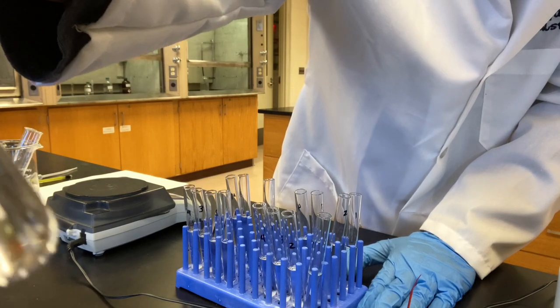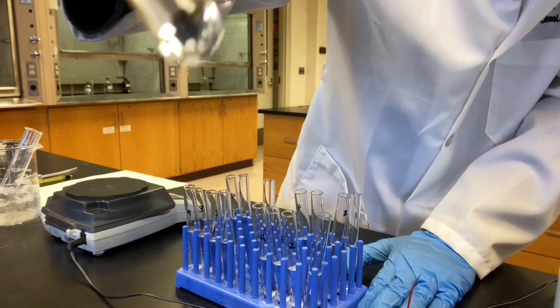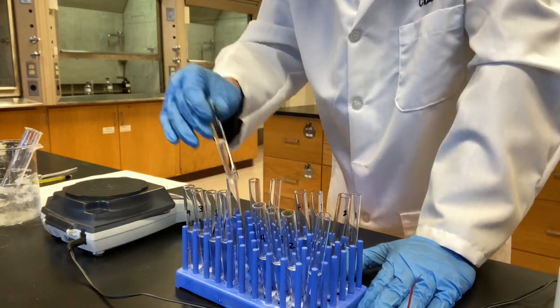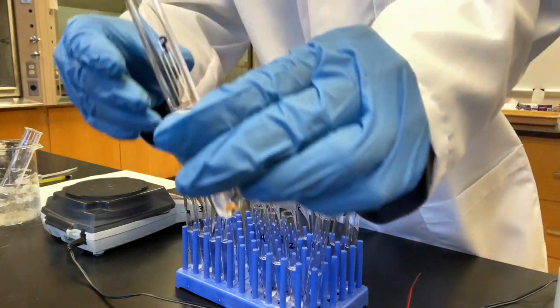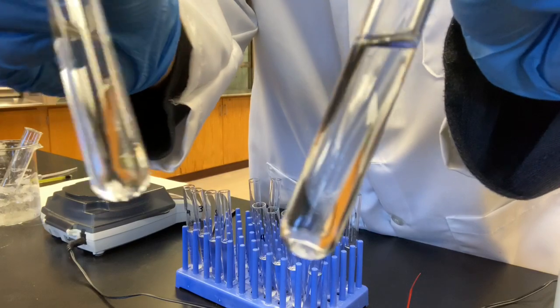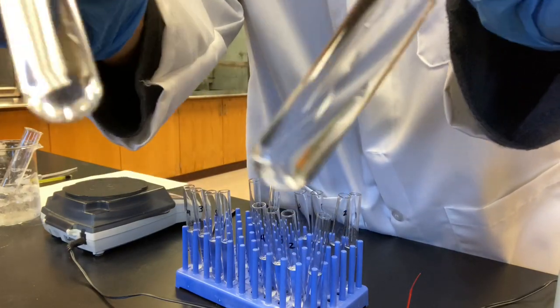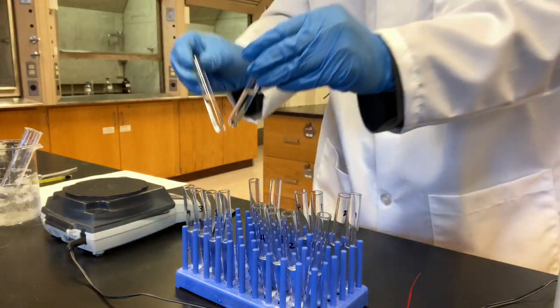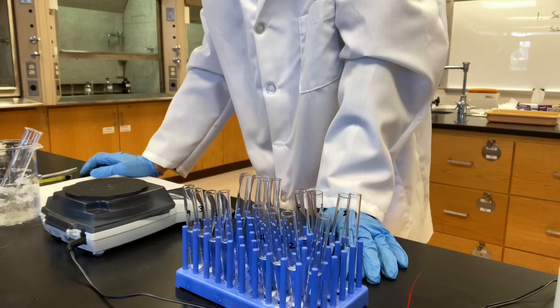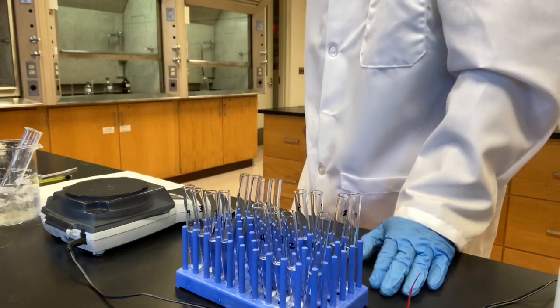I'll call it soluble. In acetone and petroleum ether, clearly all dissolved, soluble. So naphthalene in water insoluble, ethanol soluble, acetone soluble, petroleum ether soluble.